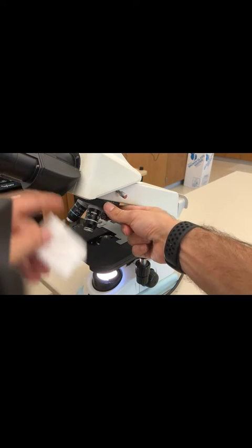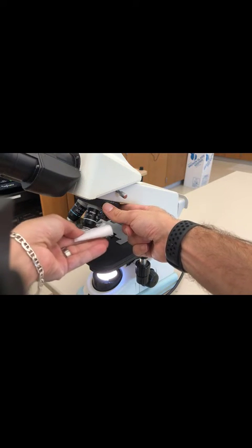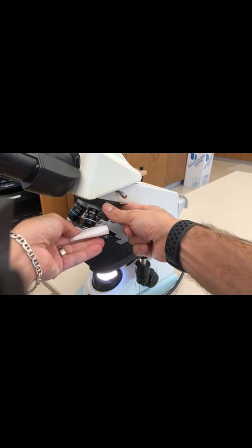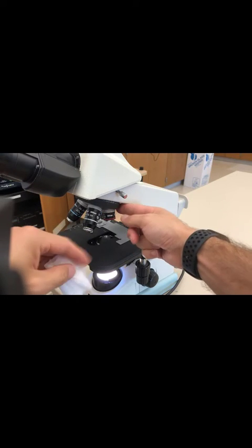And then the 100x, remember, you did get oil on there. You definitely got oil on there. So you're going to clean this extra good.